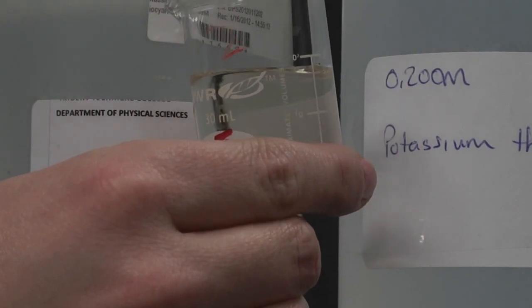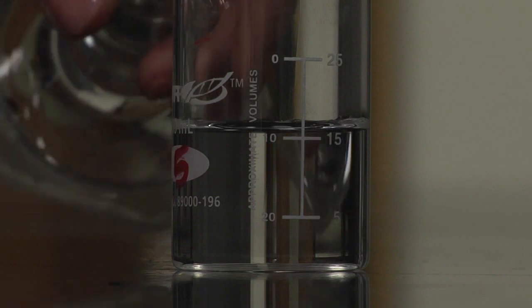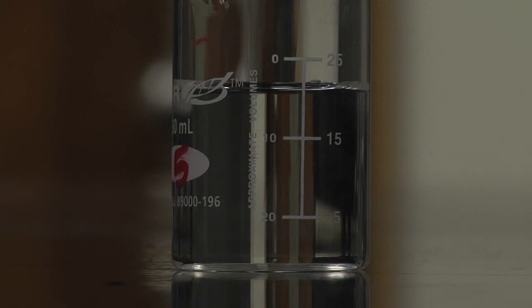Now we're going to add 5 milliliters of our iron.